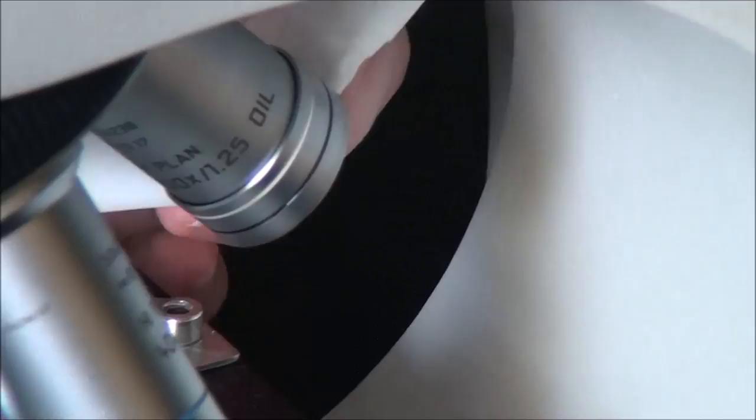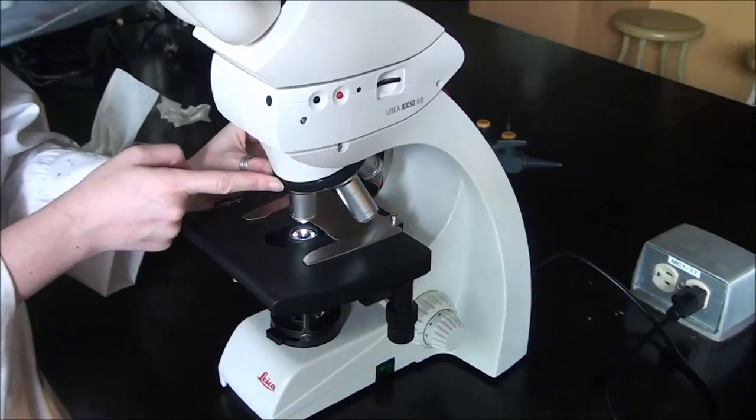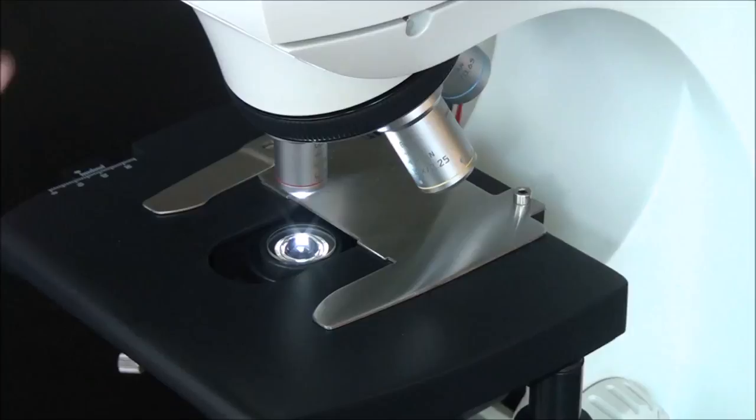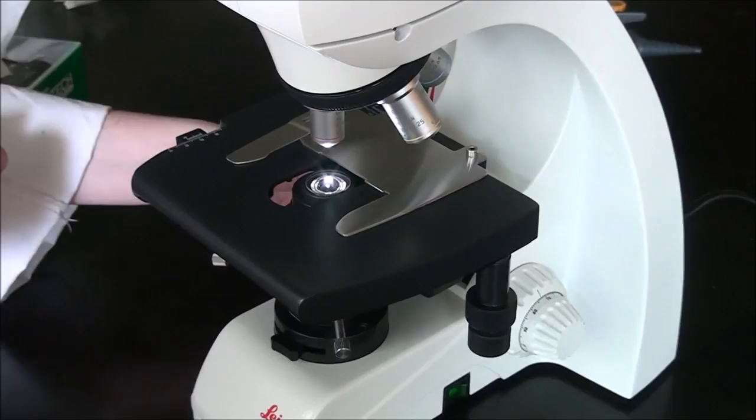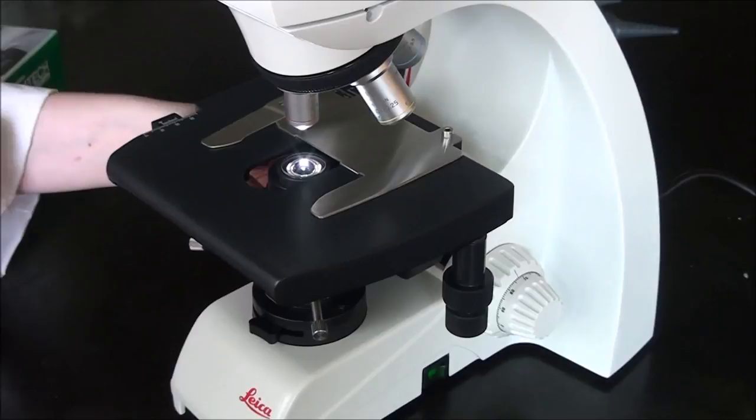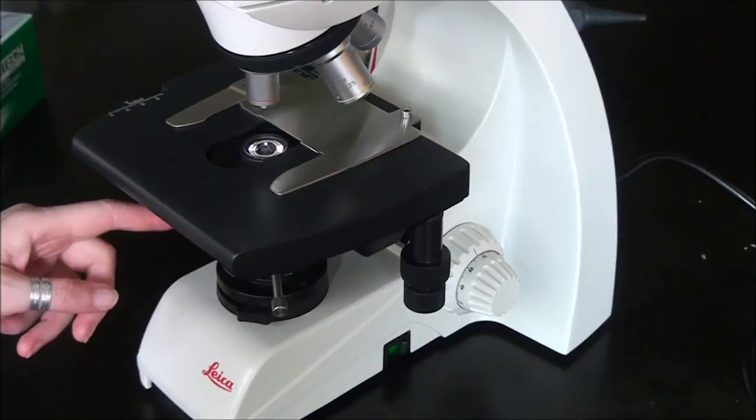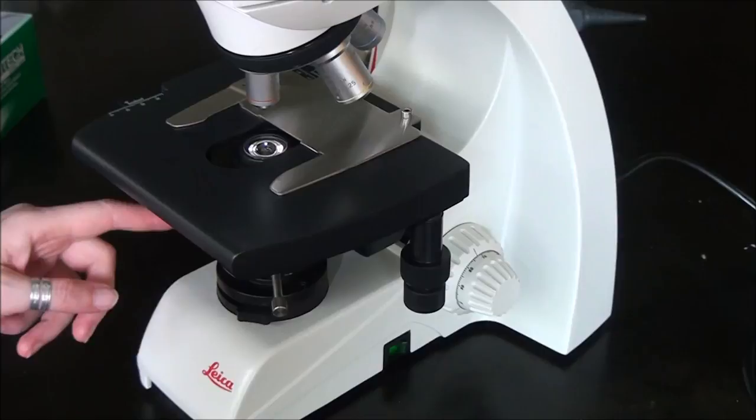To finish our cleanup, we want to make sure that we have either the 10x or even better the 4x lens because there's a really big gap so it's less likely to have damage. We're going to make sure that the stage doesn't have to be all the way down but is out of the way enough that it's not going to hit any of the lenses. Lower the condenser a little bit to also give it some space. We're then going to close up the field diaphragm, close up the iris diaphragm of the aperture, and turn off our microscope.